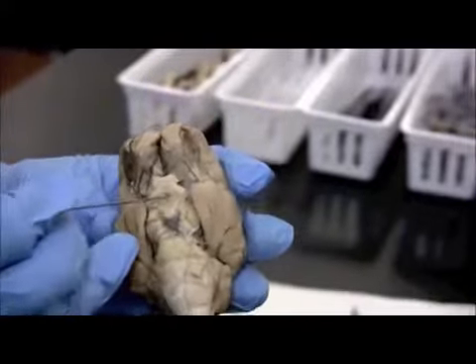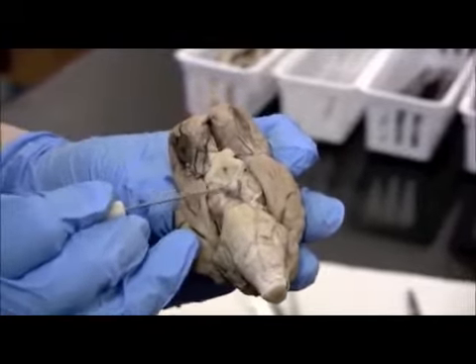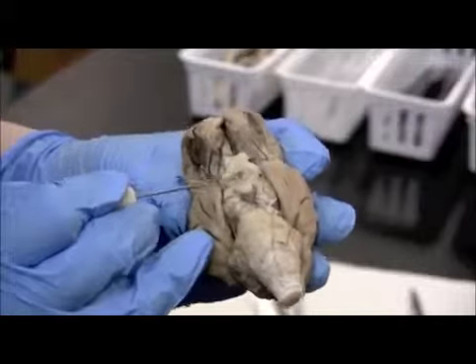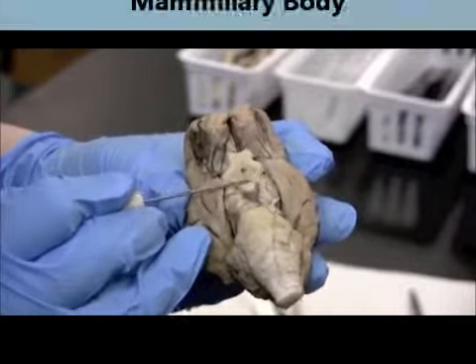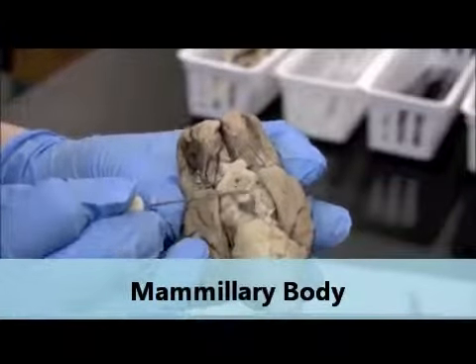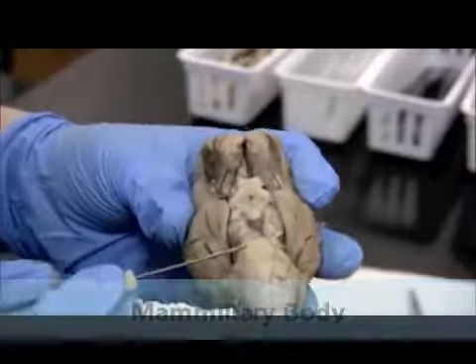Okay, so these right here behind the infundibulum hole, and that just gets cut off when they prepare the brains. These bumps directly behind are going to be the mammillary bodies. And let me see if the other brain has a better view.